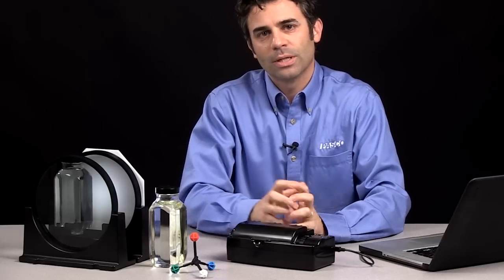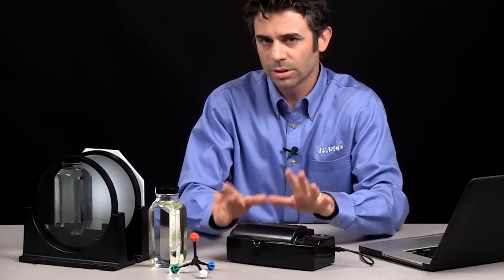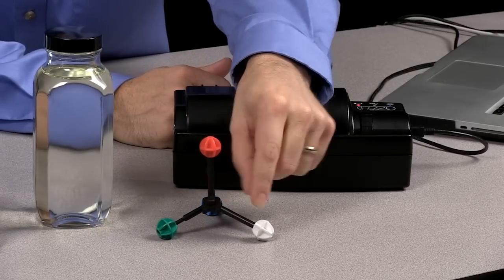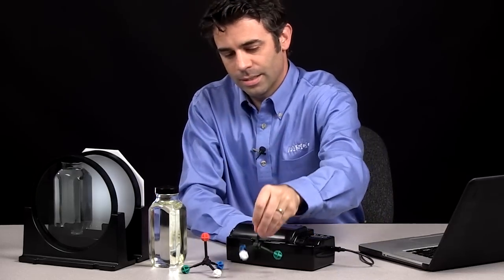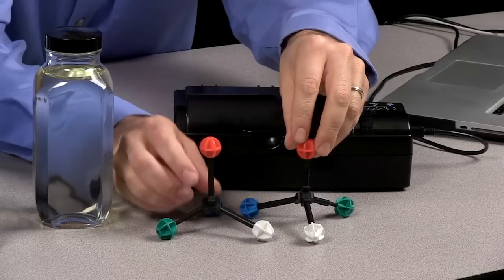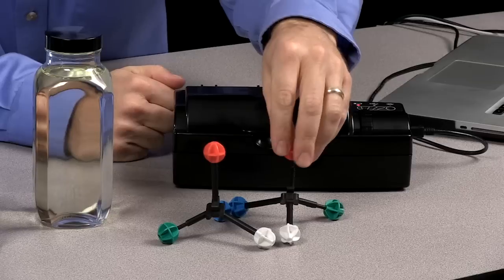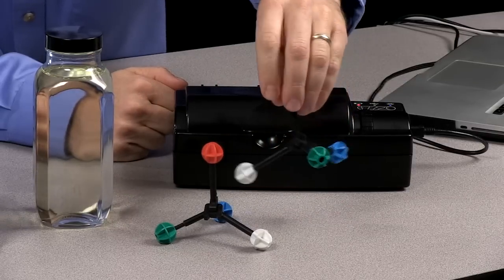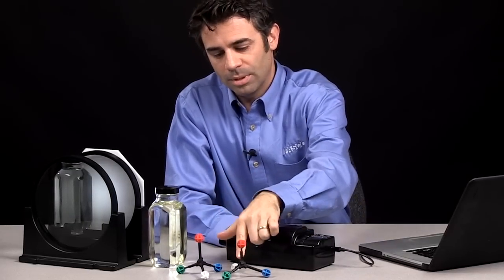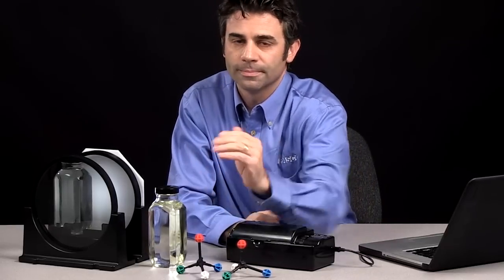The polarimeter is a device used to measure the rotation of plane polarized light by optically active compounds. Assume this is a compound with a central atom and four different atoms attached to it — the same central atom with the same four different atoms, but these are actually different compounds. These are non-superimposable mirror images of each other, called enantiomers, and these enantiomers happen to have a chiral center. That chiral center will rotate the plane polarized light either this way or this way, depending on the compound.